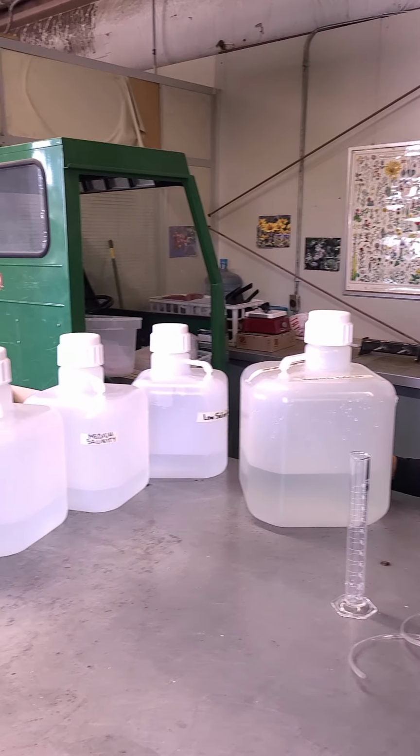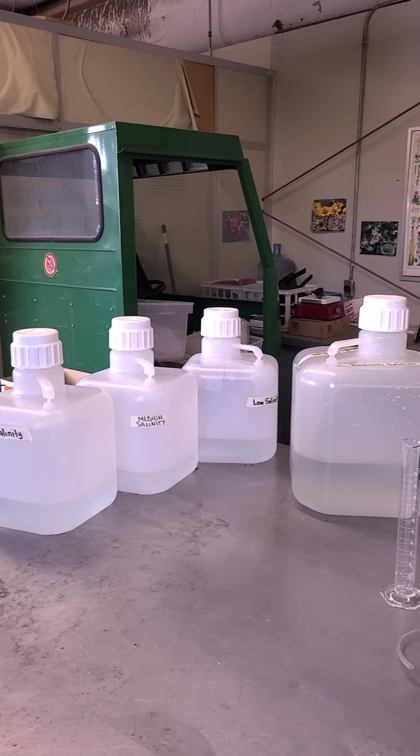You can see some of these carboys that we've got here. We've already made up our solution. And the Hoagland's solution by itself, with nothing added to it, as I said, is a complete plant nutrition, if you will. And that is what we're calling our control. And then we have a low and a medium and a high salinity, and that's all going to be in your lab exercise handout. So you can see what we did there. You can see what the different ratios of the chemicals are, etc.